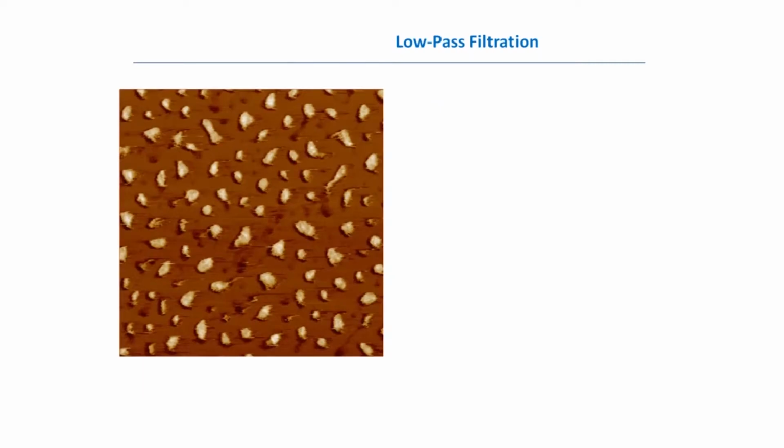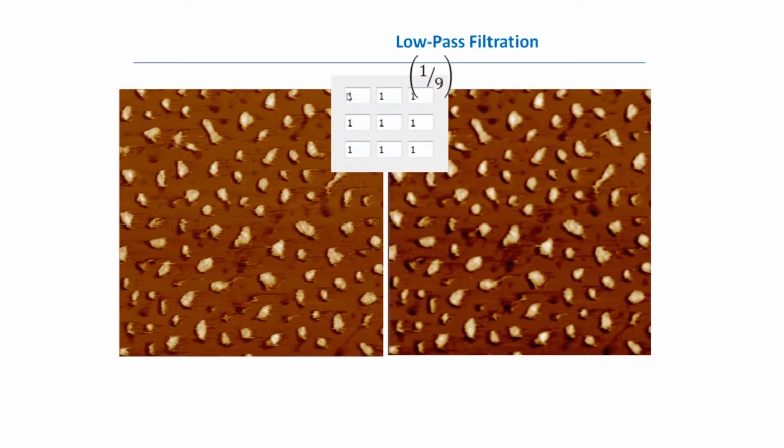So first of all, a few words about low-pass filtration. Here you can see the image, which has nice features, but also you can see high frequency noise in it. We can use filtration to eliminate this high frequency noise. So if we apply a smoothing filter, which has a kernel matrix looking like this, what does this matrix mean? It means that for the central point, we convolve the surrounding points, and actually in this case the central point will be the average of the surrounding points. That means that if we have some high frequency noise, this noise will be averaged.